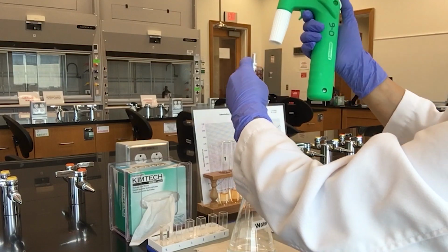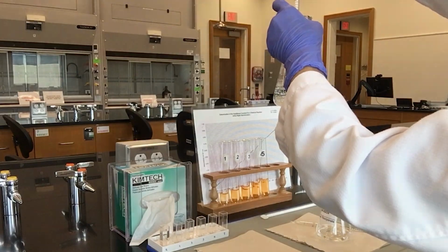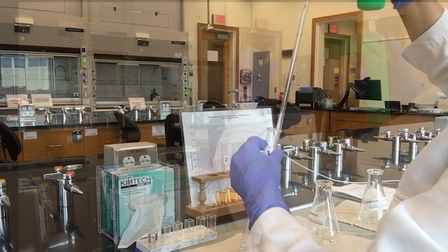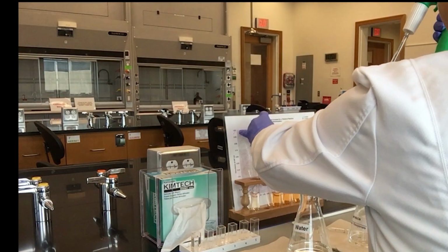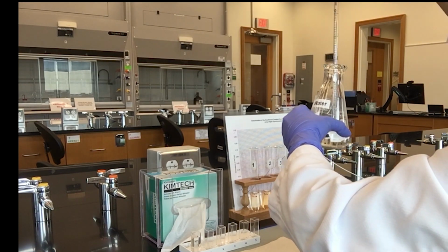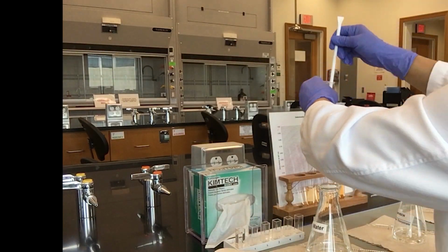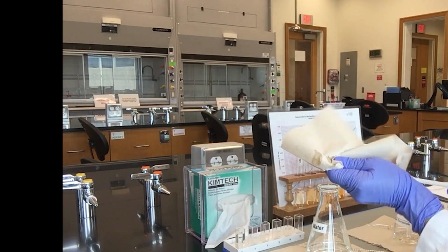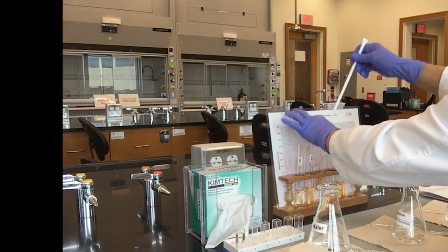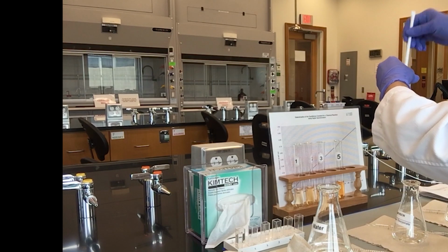When done with the potassium thiocyanate solution, you may start adding water. However, pipette 4, 3, 2, 1, and 0 ml of water into test tubes 1 to 5 respectively. The total volume of each test tube should be 10 ml. When complete, mix each solution thoroughly with a stirring rod, making sure to wipe dry the stirring rod after mixing. Continue mixing with the remaining test tubes.